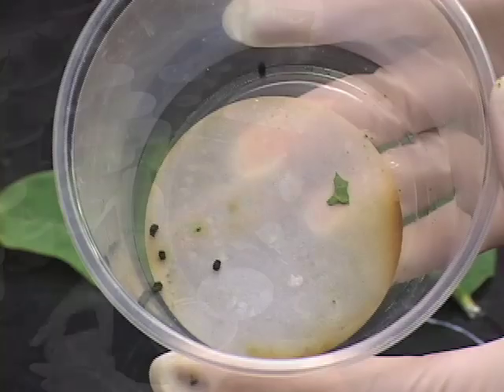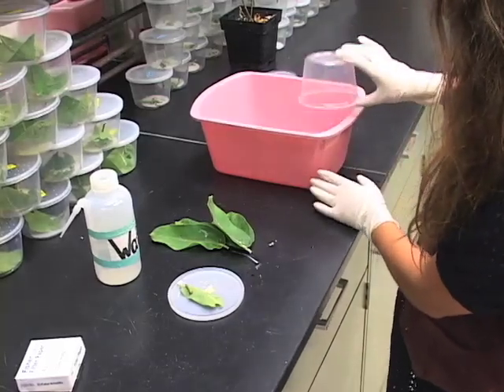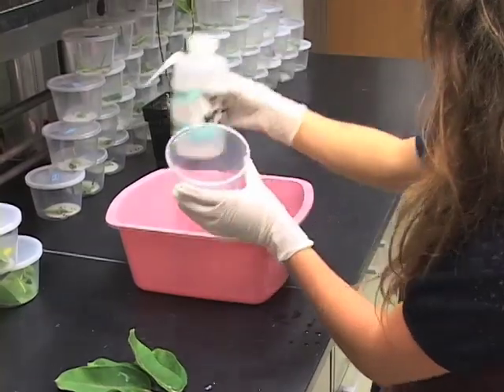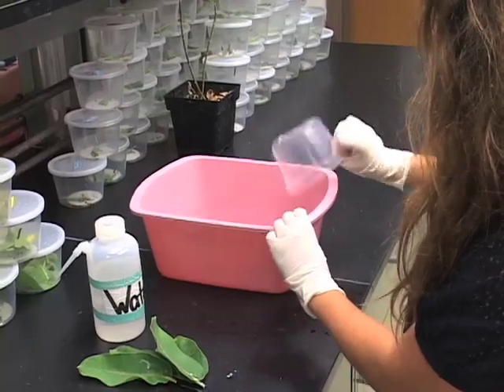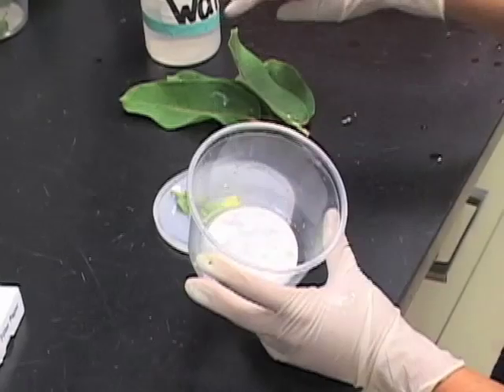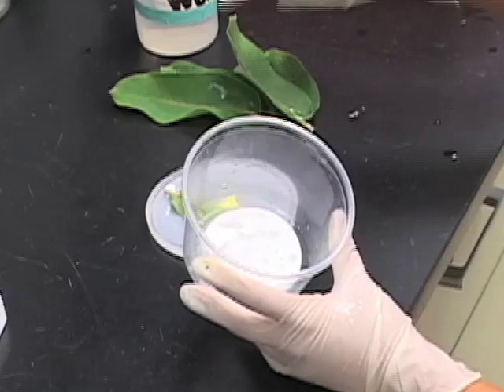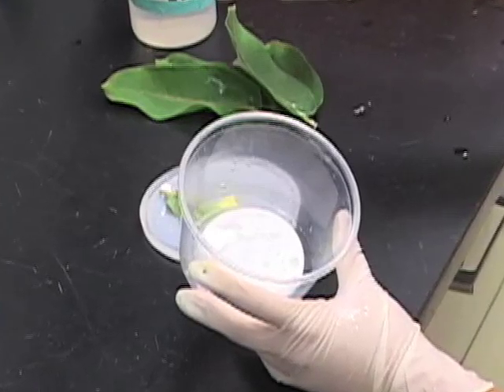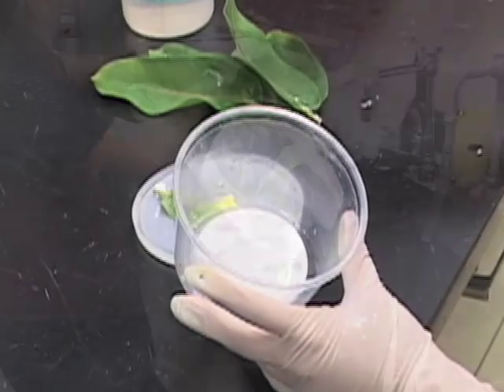Cages must be cleaned daily by emptying out the frass, or the poop, and old milkweed. Wash your container frequently — at a minimum every time a monarch emerges in the container — using a 20% bleach water solution. Make sure there isn't any standing water or condensation in the container, as too much water encourages mold growth, can make it difficult for larvae to molt, and can even drown them.